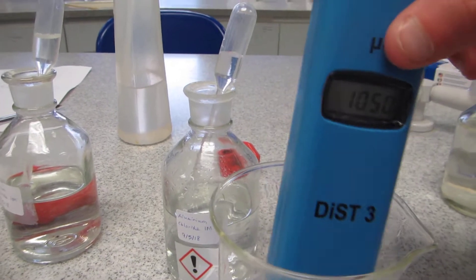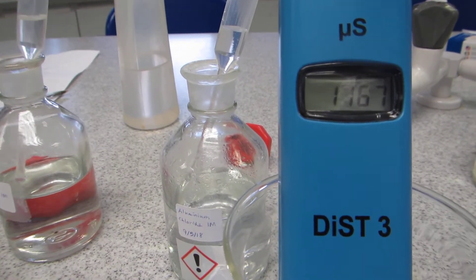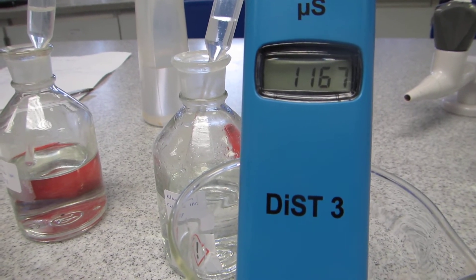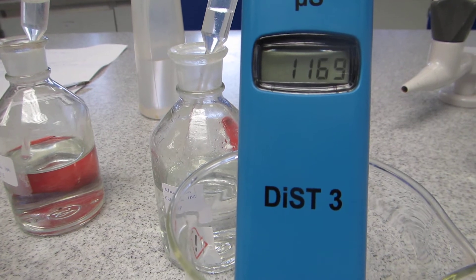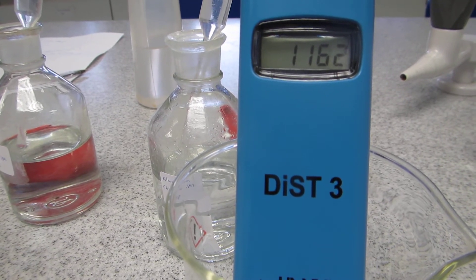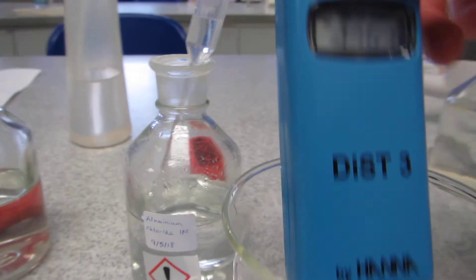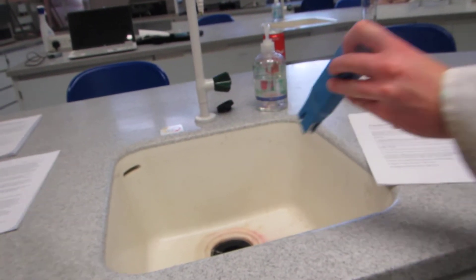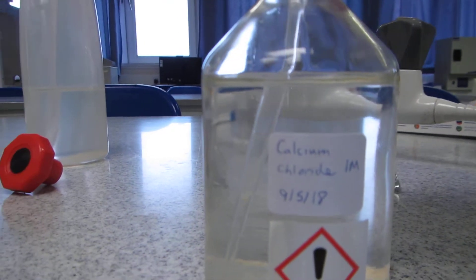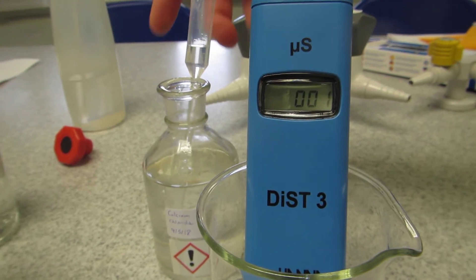That's the conductivity with ten drops of aluminium chloride one molar solution. It's settled now, so I'm going to rinse the electrode again and then move on to our final one, which is one molar calcium chloride solution. I put it into deionized water so the conductivity reading has gone straight down.